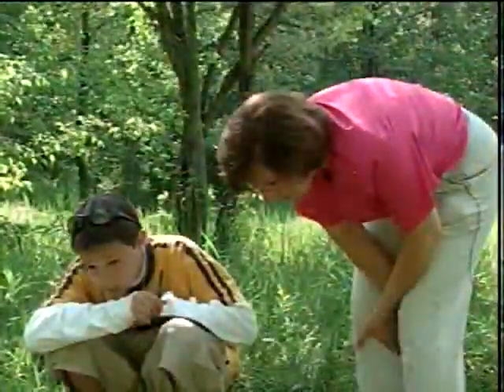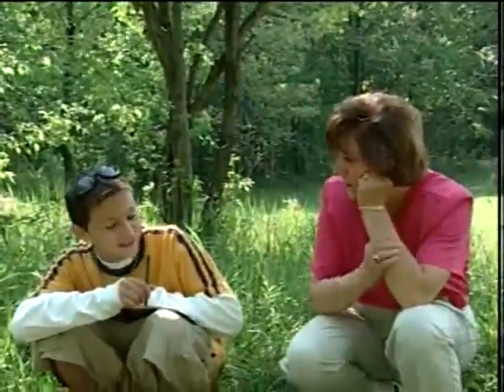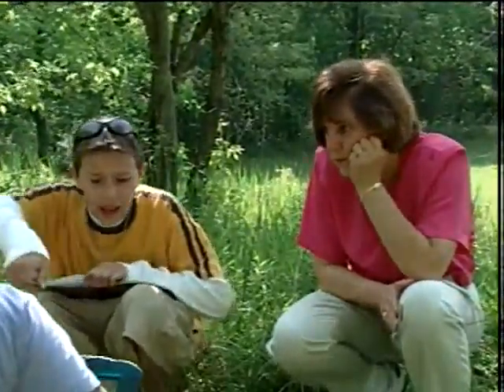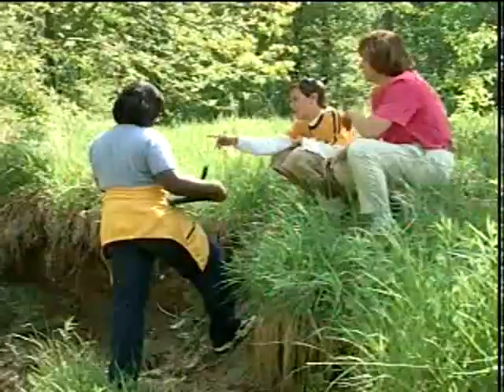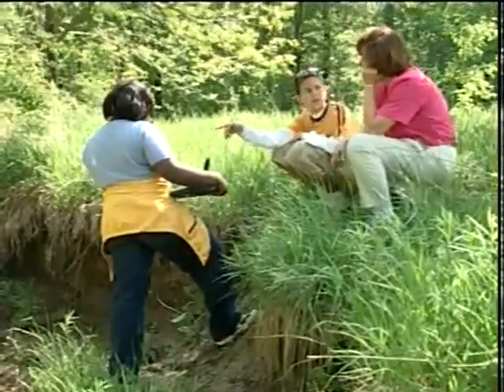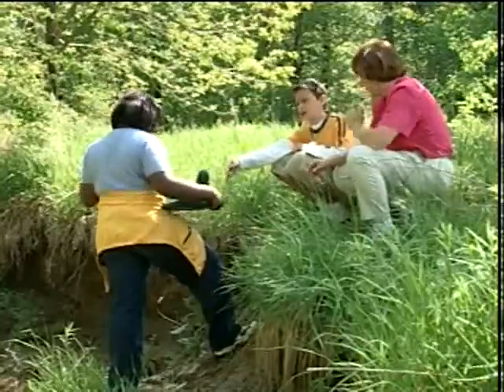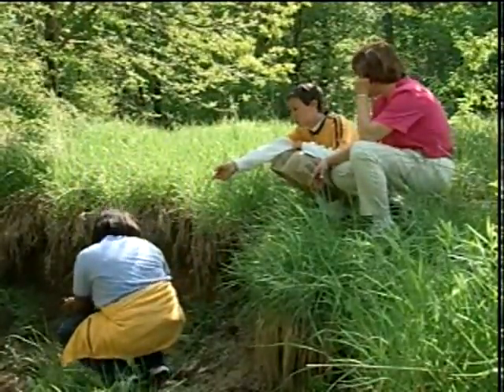What did you have in the winter? 4,000. No, 1,400. 1,400, okay. I think it's significant. Okay, what do you need to check first? What do you want to check? Have that lever down as far as you can. So I would check the calibration. Okay, over 2,000. You want to check if you have it on the conductivity calibration. Sure. She had it on the wrong setting, so now let's see what she has.